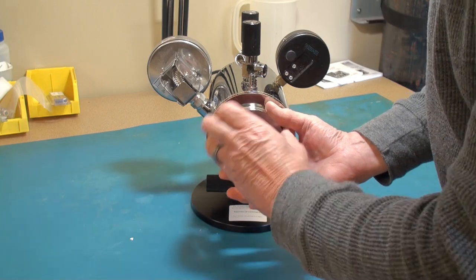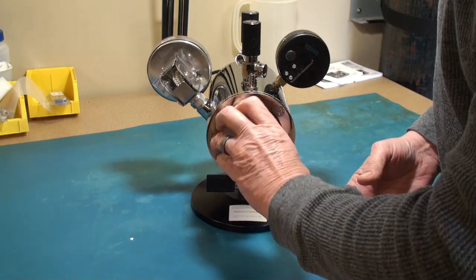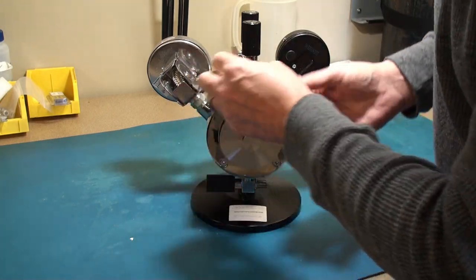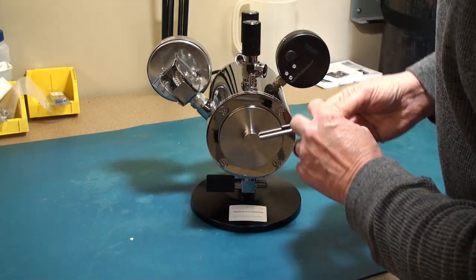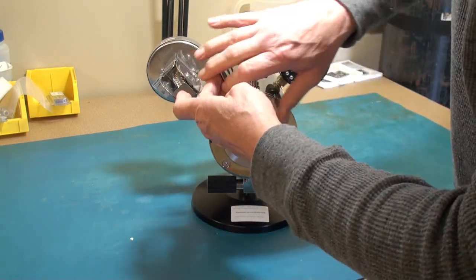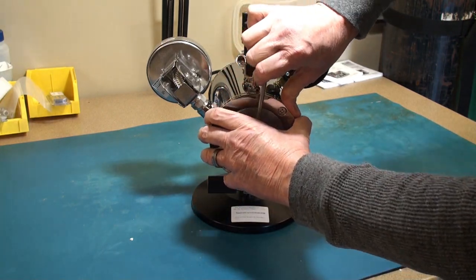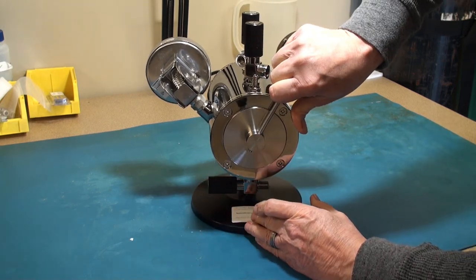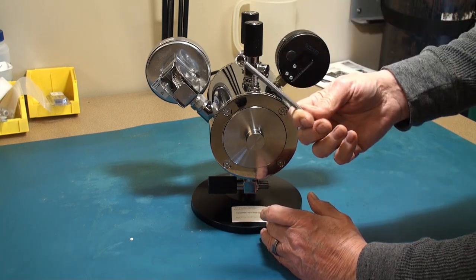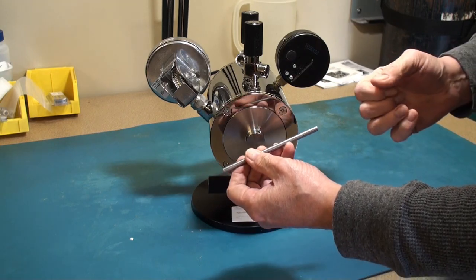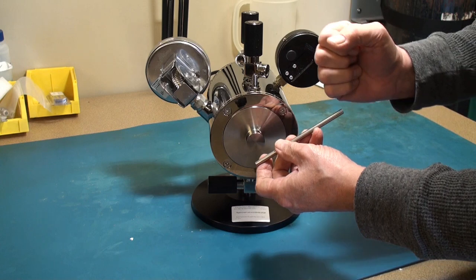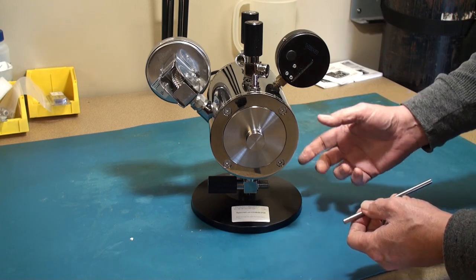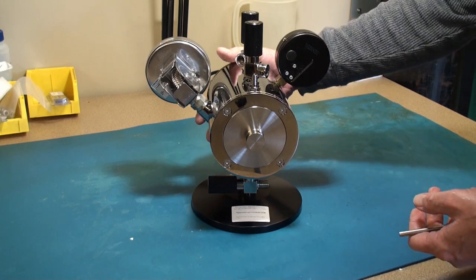And then you would put the door on. And the door would interface with that button. And as you screw it closed, it would allow the CO2 to start to drain. And you want to use a moderate amount of force. You'll sort of have to get used to this but it really won't go any further. And the idea is that we don't want a long bar for you to over torque the back of the fitting. Once pressurized this will become virtually irremovable and you'll not be able to open it.